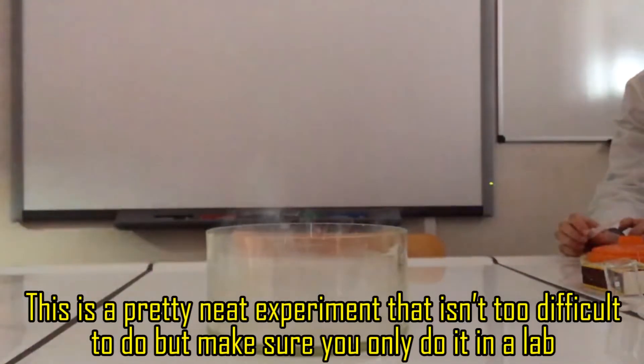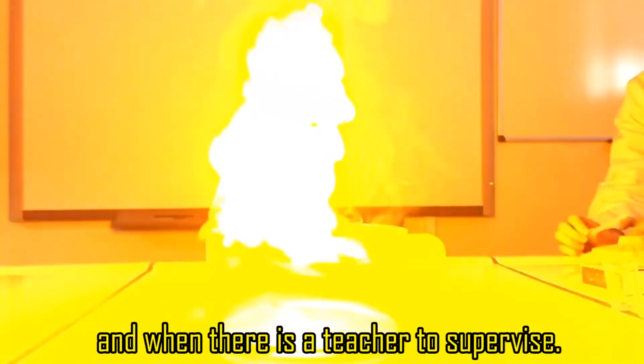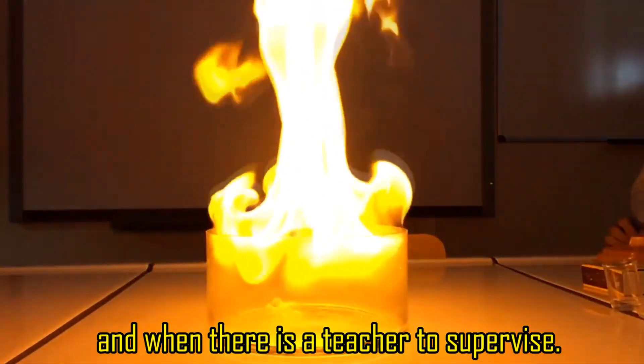This is a pretty neat experiment that isn't too difficult to do, but make sure you only do it in a lab and when there is a teacher to supervise.